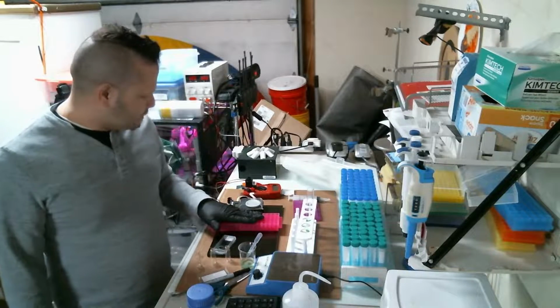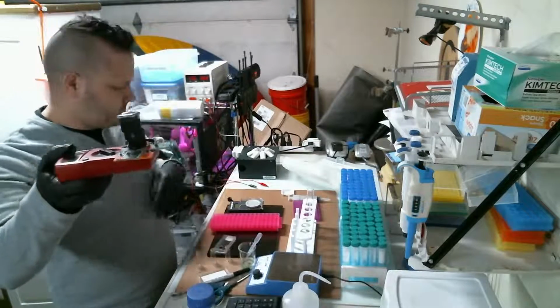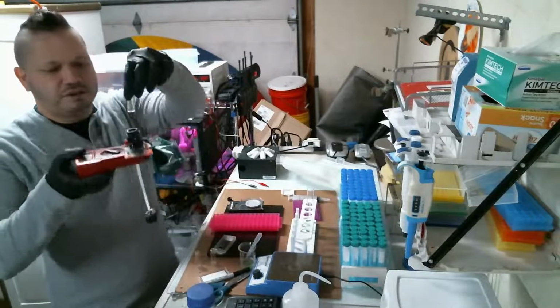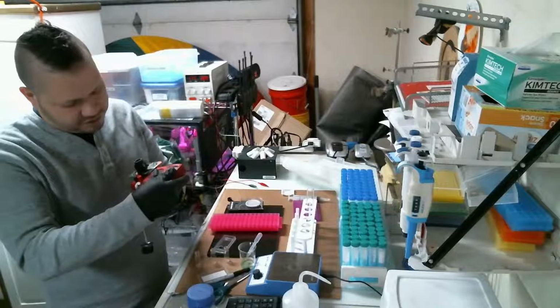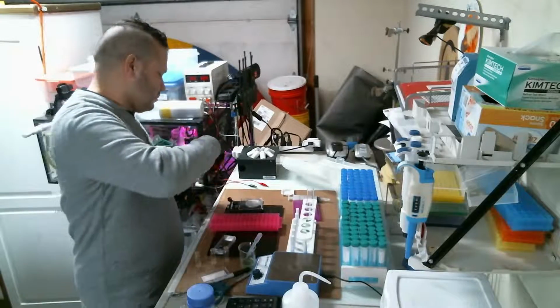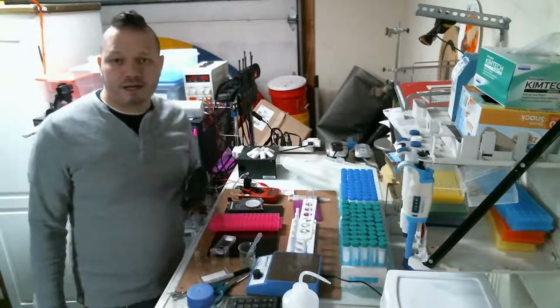So yesterday what I was doing was calibrating this thing. It's a thing to count algae cells essentially. You put the vial in there with a sample, and it spits out a number, which is the voltage, which you convert to current, and then by plugging it into an equation, you get the density.